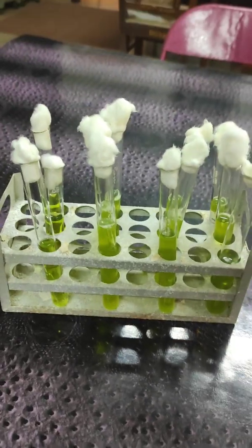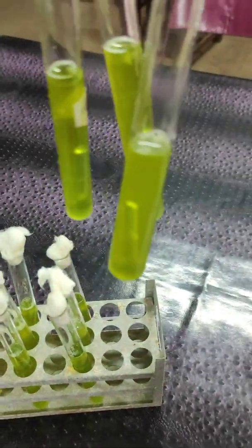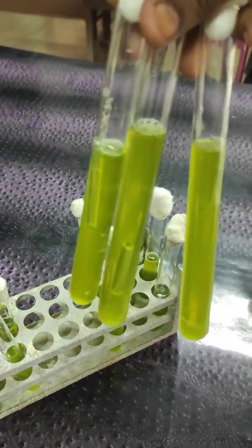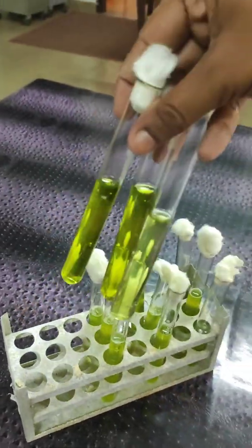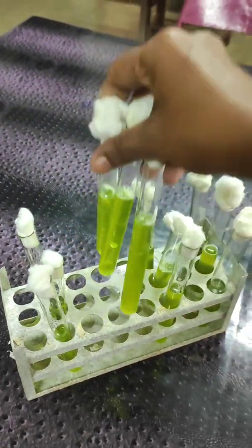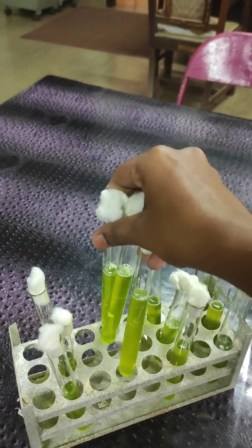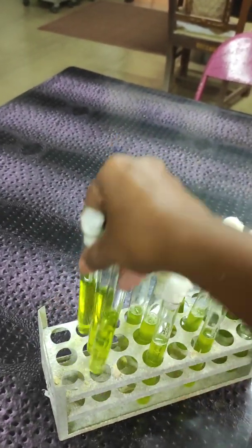The formation of gas in any amount in the brilliant green lactose bile broth fermentation tube at any time within 48 hours constitutes a positive confirmed test. Here gas is formed and it is a positive confirmed test, confirming that coliforms are present in the given sample of water.